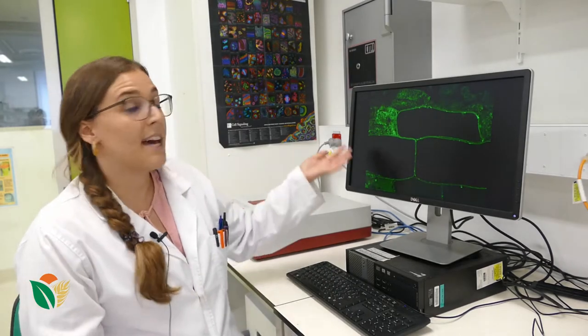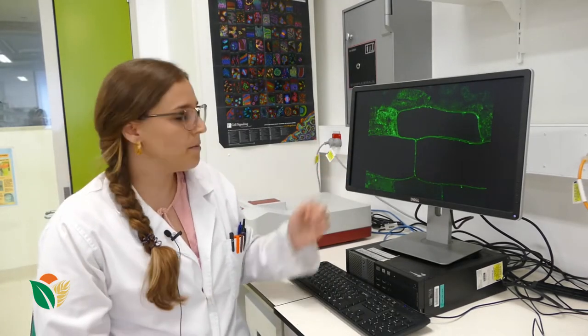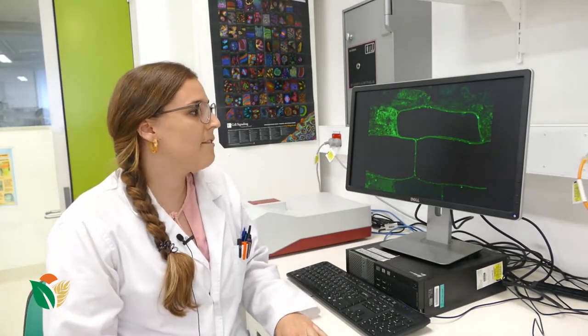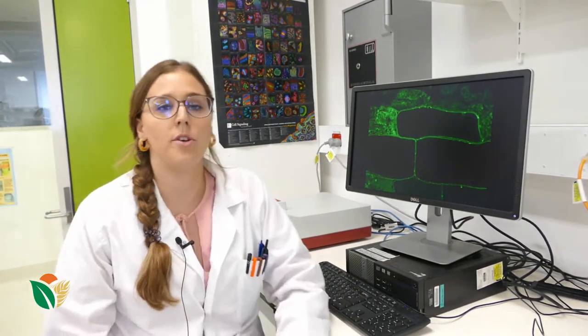Here we're looking at a plant cell. We've fused — we've attached a green fluorescent protein to an aquaporin of interest.